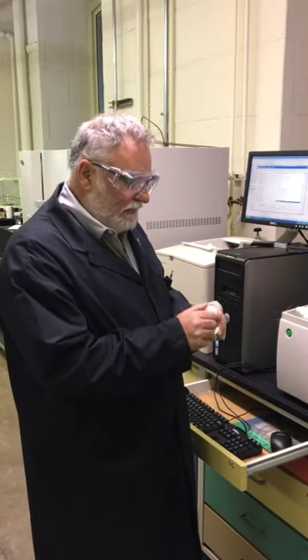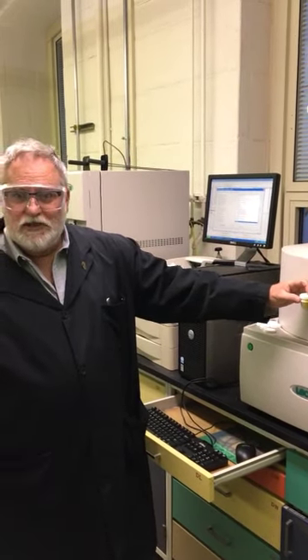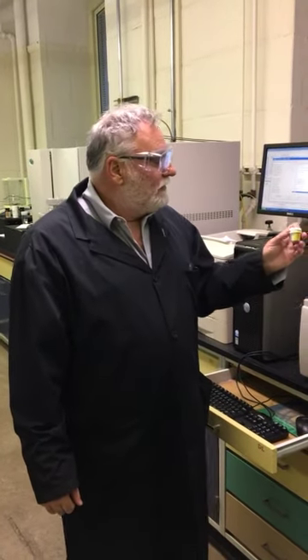So we know what the weight of the cover is. And then the process goes into its volatile matter stage. During this stage, it's going to heat up to 950 degrees Celsius. Again, read the ASTM to make sure that's the correct value. It's going to stay in an inert atmosphere. There is going to be mass loss.